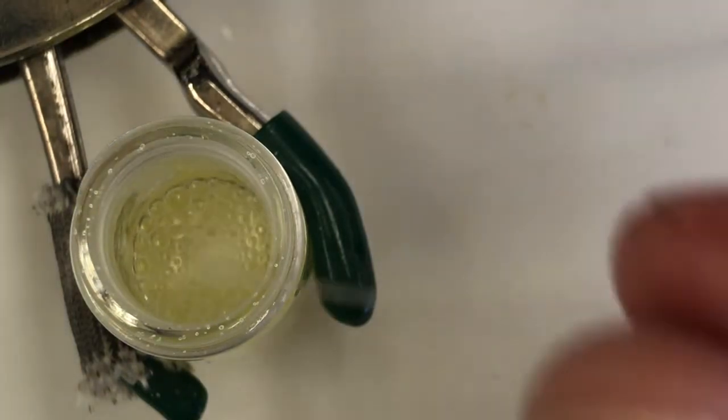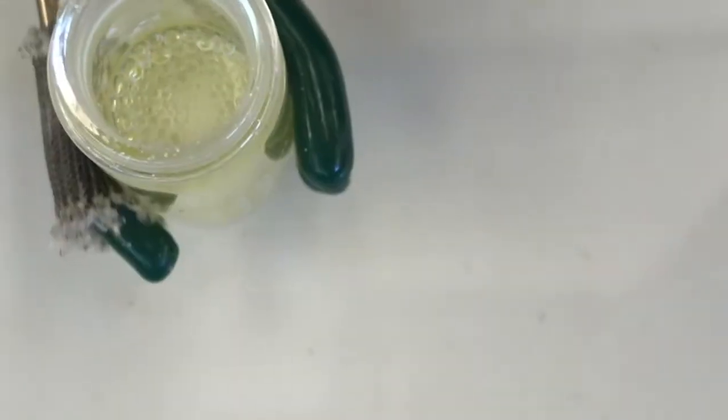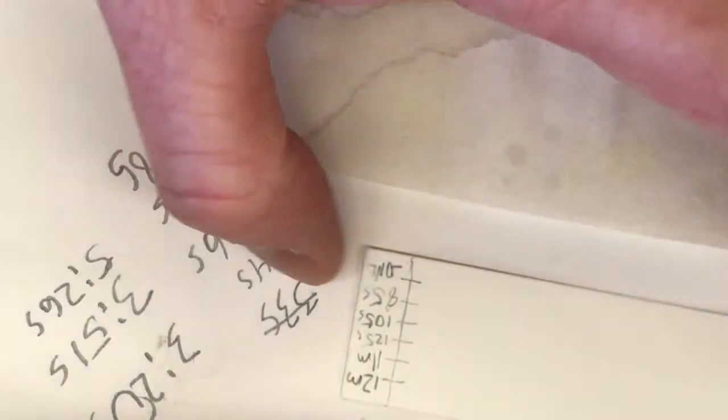Okay, actually, I was talking, I didn't keep track of the time well. Let's see, I'll tell you what time. It won't be exactly 11 minutes. Alright, so where am I? Right there. So where it says 11 minutes, I'm going to spot it at about 11 and a half minutes. So let me do that. Now, got it, 11 minutes, 31 seconds.